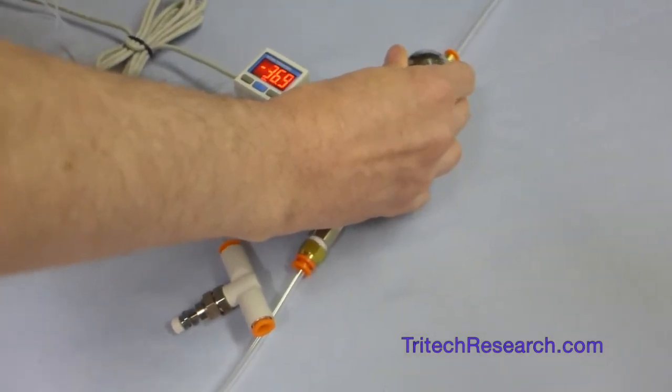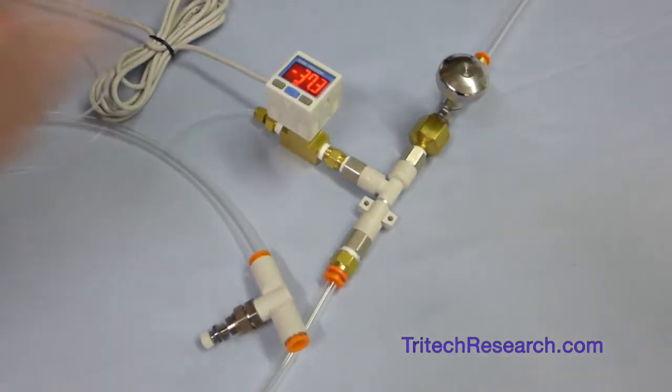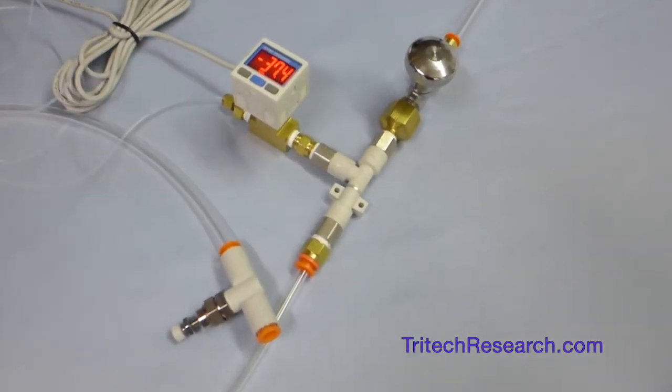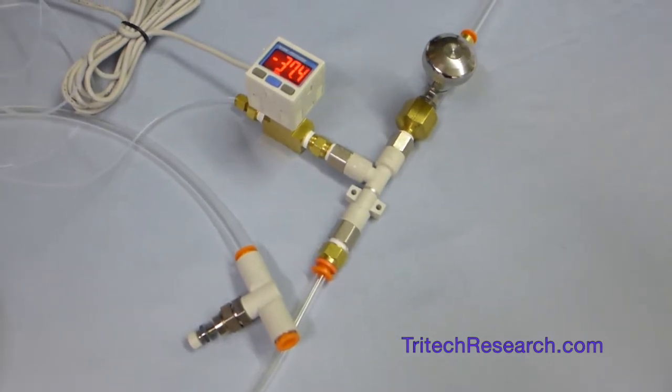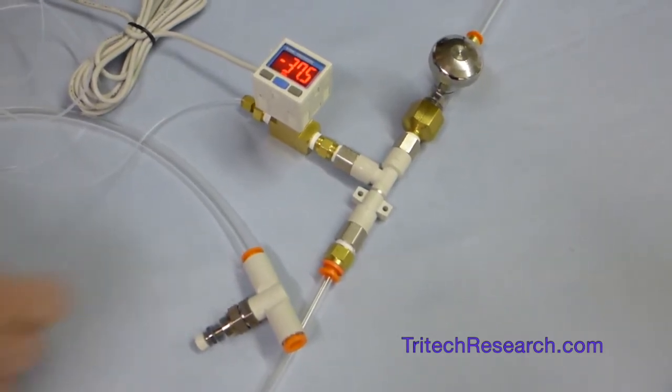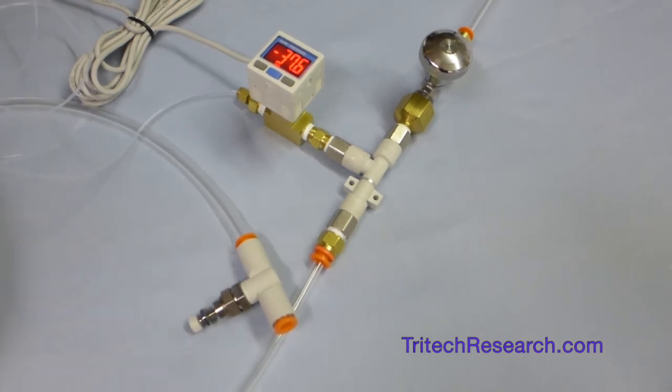But when you open it a little bit more, you can get to a lot more. So you can adjust these two things, you can get to whatever pressure you need, and you can be fairly efficient with how much gas is escaping through the system.